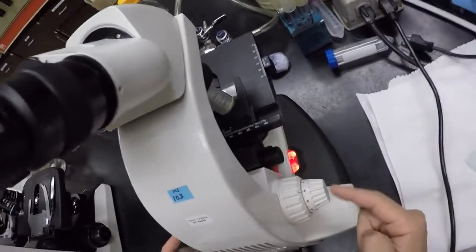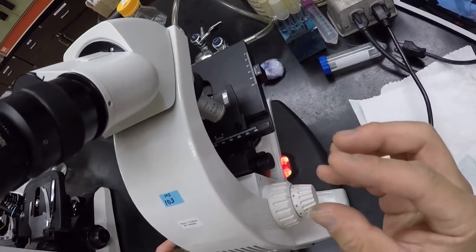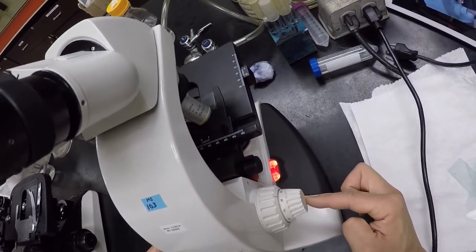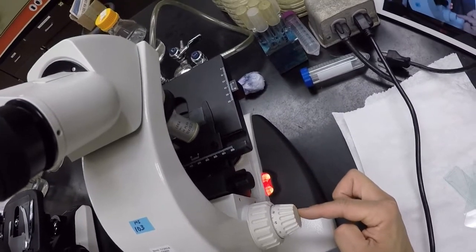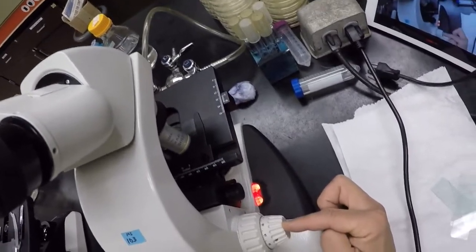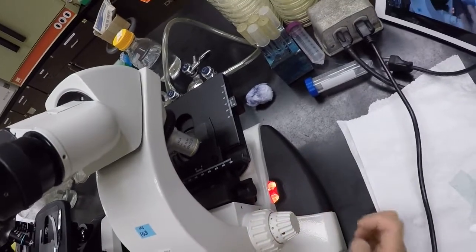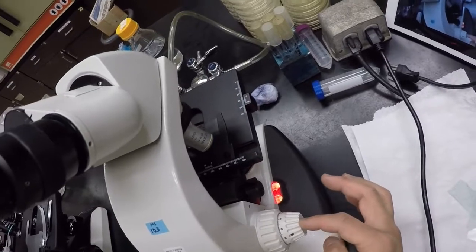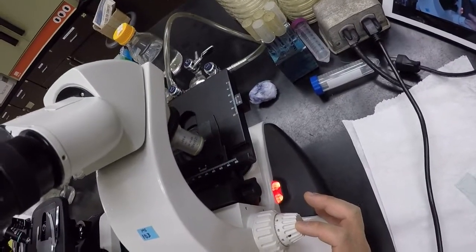Okay, so never turn this unless you're looking, because things are going to come in and out of focus very fast, right? So while you're looking, slowly turn forward within 2 rotations. And within those 2 rotations, it should be either there and focused or close to focusing. You should be able to sort of see it. And remember, parfocal, right? The focal length should be about the same, so it should already sort of be in focus. Okay? If in those 2 revolutions you didn't find it, that means you've gone the wrong way.